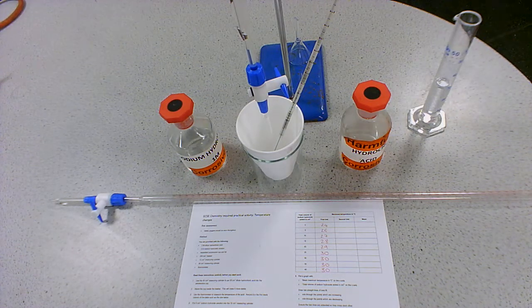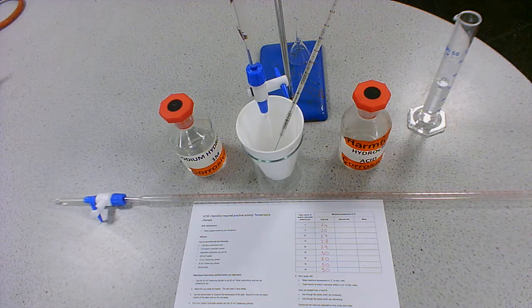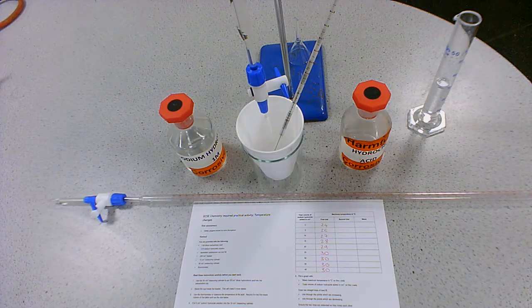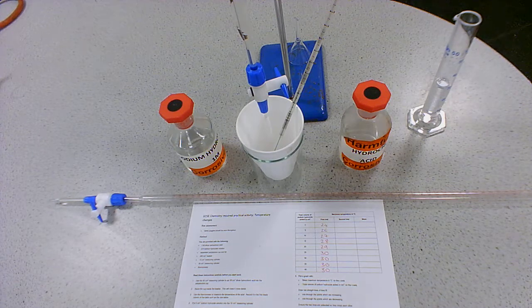All right, so this is the temperature changes required practical, so the required practical for topic five. Now, actually, it's a neutralization reaction, which I'm aware is topic four.